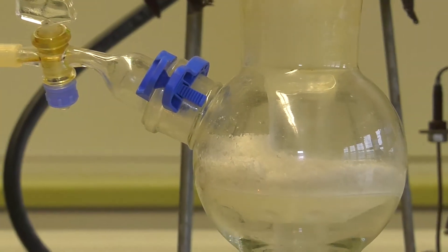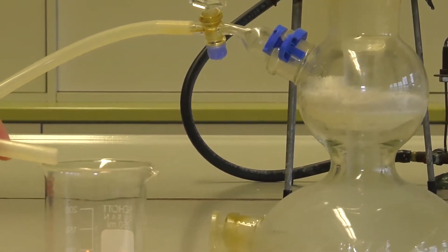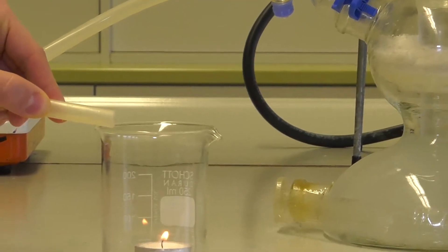After you have produced the carbon dioxide, light the candle. Take the burning candle into a beaker and fill the carbon dioxide into the glass.